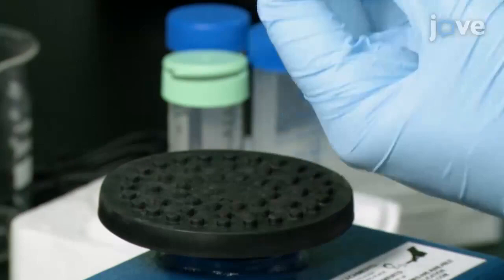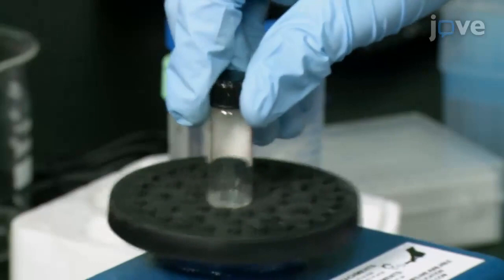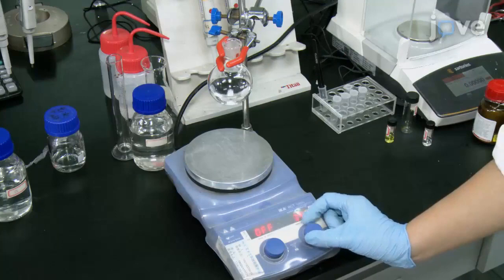Next, in a third 4 mL vial, dissolve 2.3 mg of sodium borohydride in 0.6 mL of deionized water to obtain a 0.1 M solution, which should be used within a few minutes.